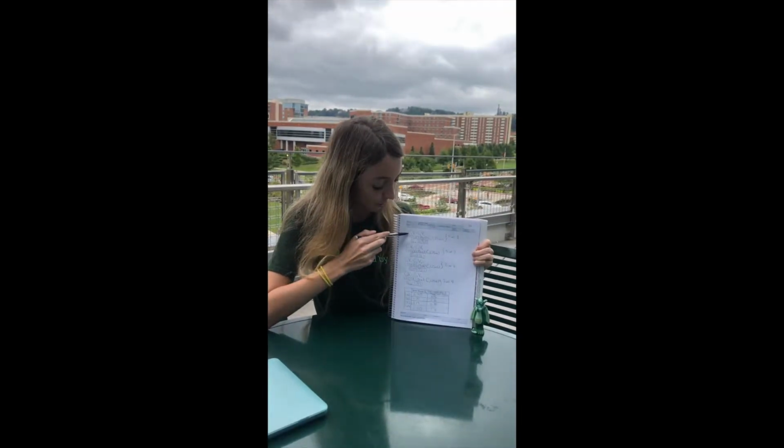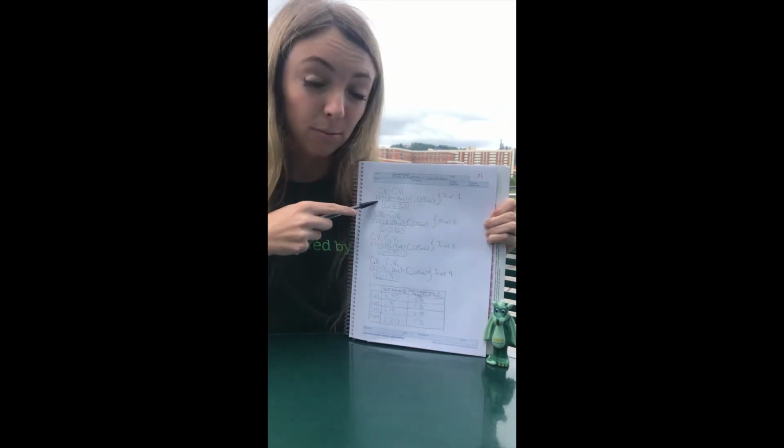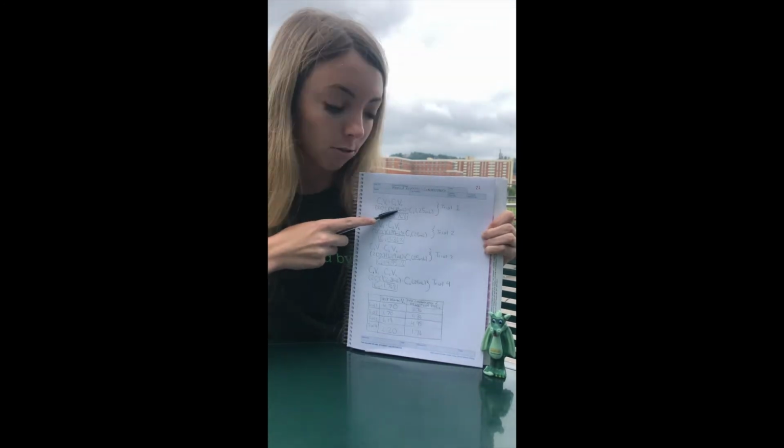So we can use this equation, C1V1 equals C2V2, to determine the concentration of the sugar solution after it's diluted. So we start with C1, which is the concentration of the stock solution. It's 20%, always. And then we recorded the V1, which is the volume we pipetted out of the stock solution into the volumetric flask, and we got 4.7 milliliters of stock solution.